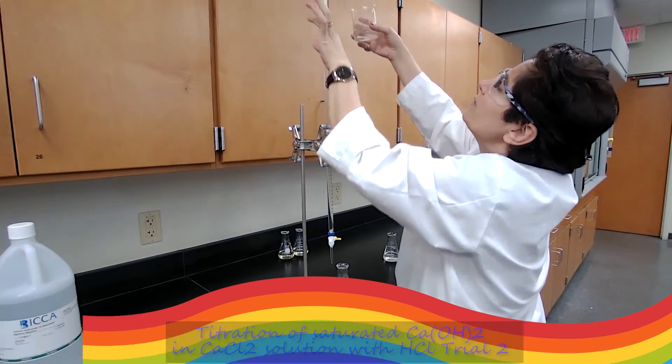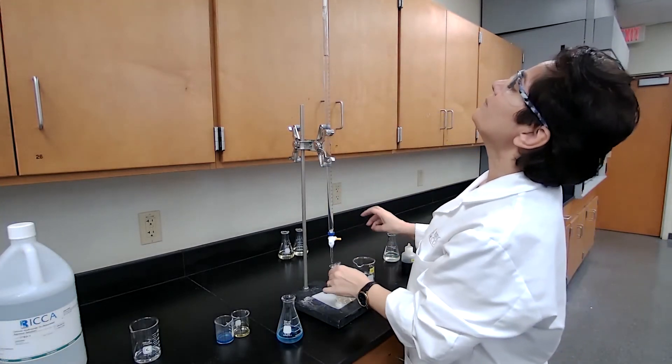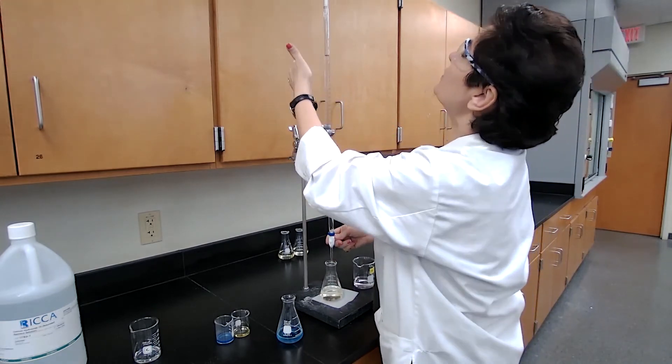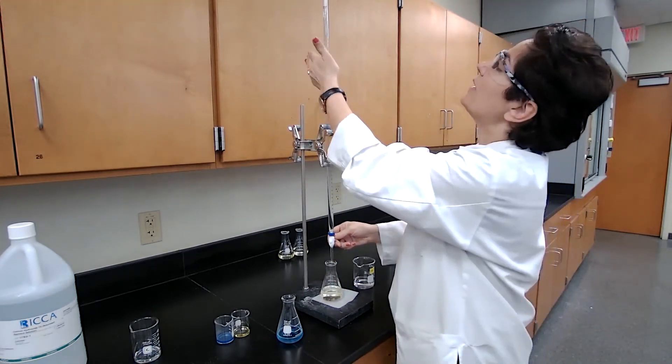And this time I'm going to start again with 10 milliliters. So let me adjust to that. And so you don't get used to just starting from zero all the time. It doesn't have to be zero.